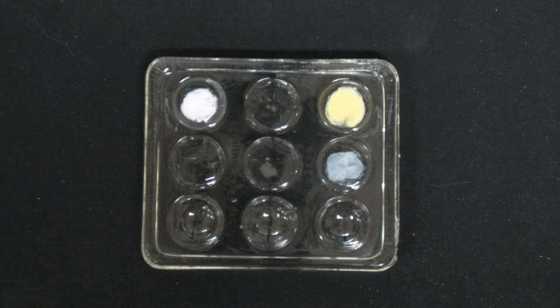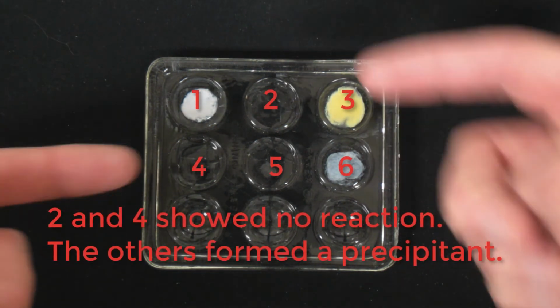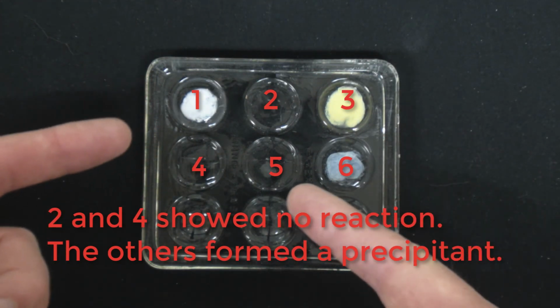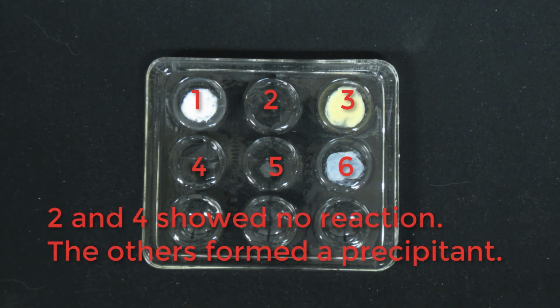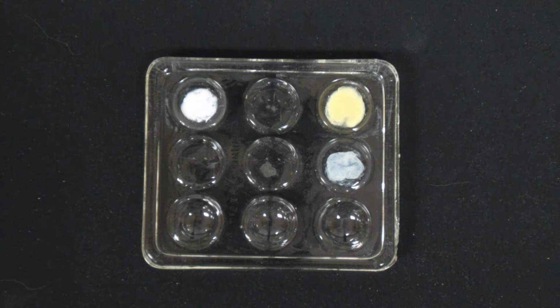So again, a recap. Of the 6 reactions that we see here, the second one and the fourth one we're going to consider as no reaction, and all the other ones, including that calcium nitrate plus the sodium sulfate, as at least a slight precipitate in that one. And yeah, so for those 4 where a reaction has occurred, you will fill in the formula for the insoluble salt in the last column of part A, and then you will also complete those balanced equations for part A as well.